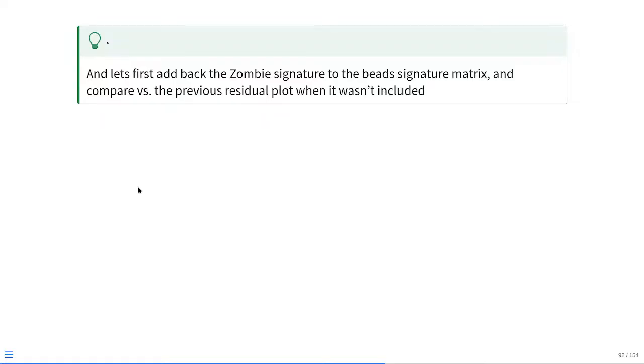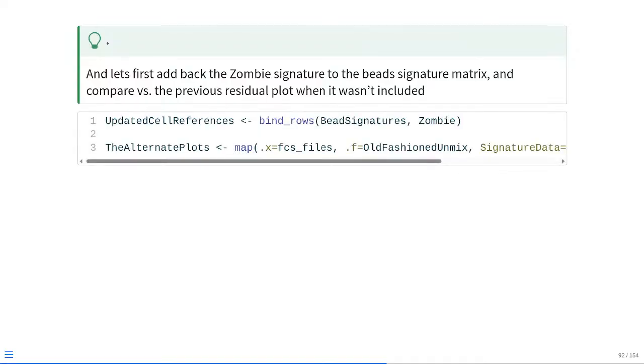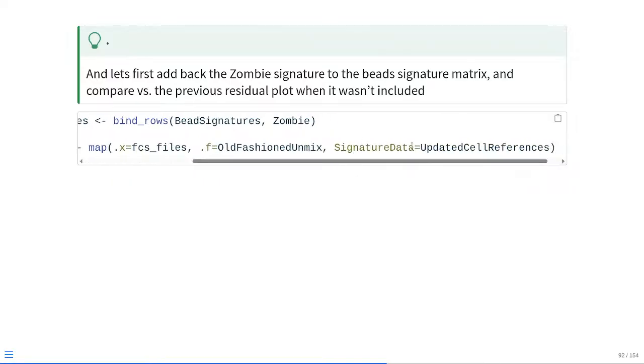So at that point, let's go ahead and start by just adding back in the zombie signature to the bead signature matrix, and then compare the before and after residual plot to see what happens when we actually remember to include all the signatures. So to add it into the existing signatures, we can either use rbind or dplyr's bind_rows function, just to combine them together. And then at that point, the updated signature references is going to be passed to the signature data argument. We rerun this at that point in time.